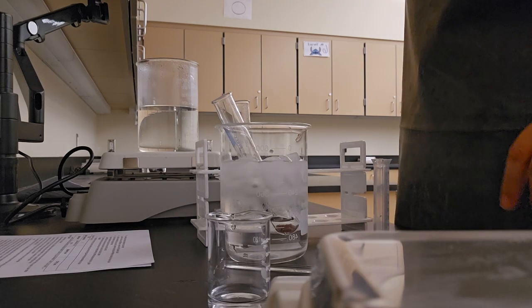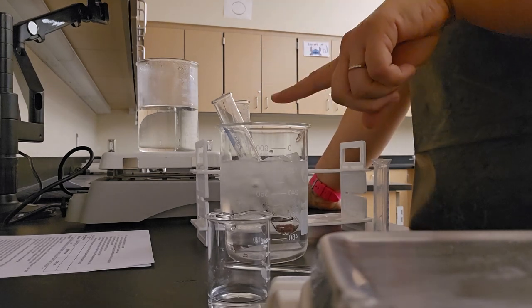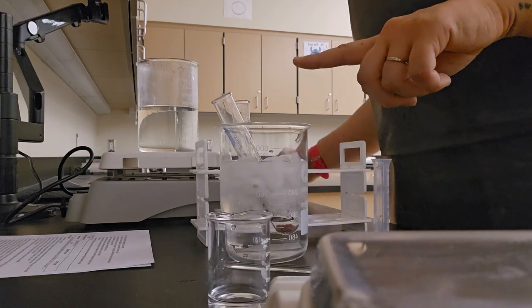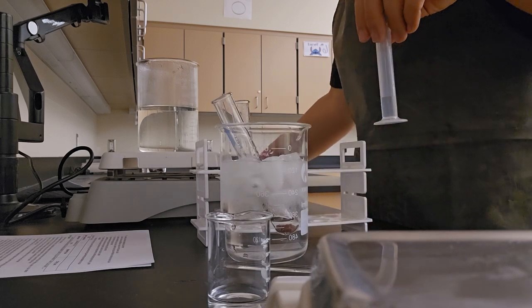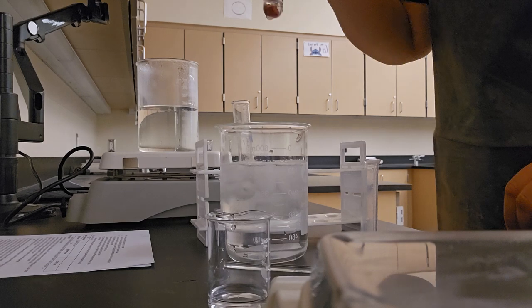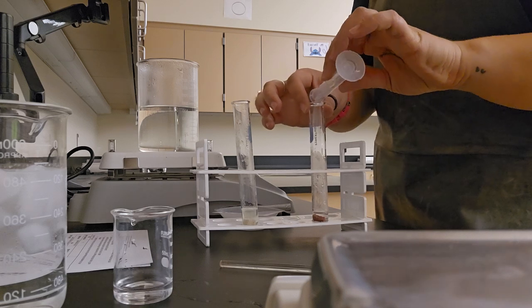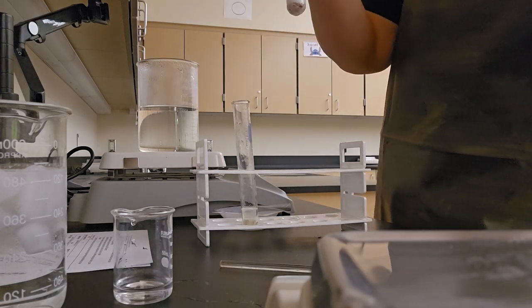All right, welcome back. We're at about 4 minutes, 50 seconds. So, quick recap. We've had our second liver sample with a little bit of water in the test tube, soaking for about 5 minutes now in our cold water bath. I have measured out my 2 milliliters of hydrogen peroxide and stop the timer. We are going to immediately take it out of the cold water bath. Move things so you guys can see. And add our 2 milliliters of hydrogen peroxide to our cold sample.